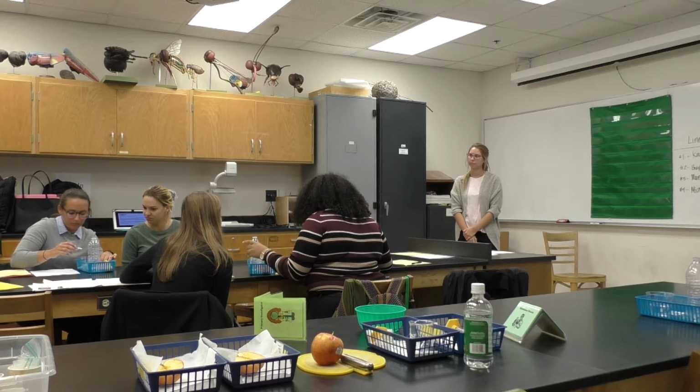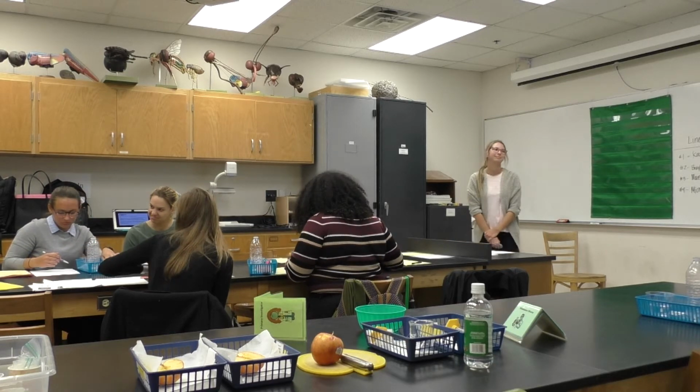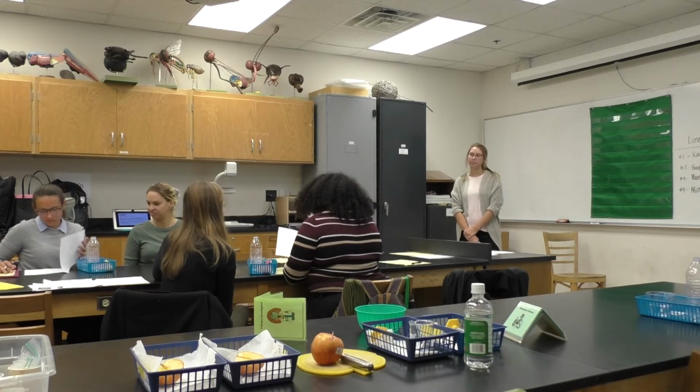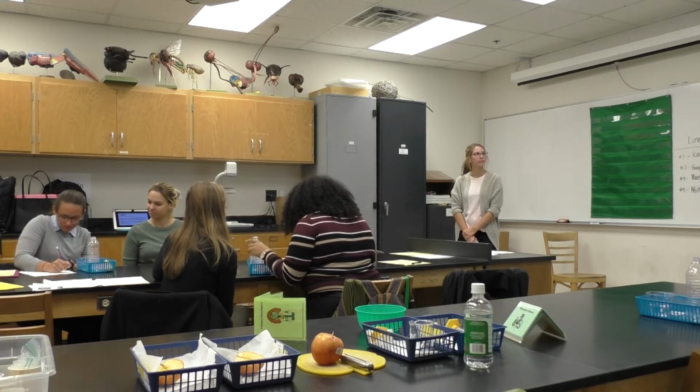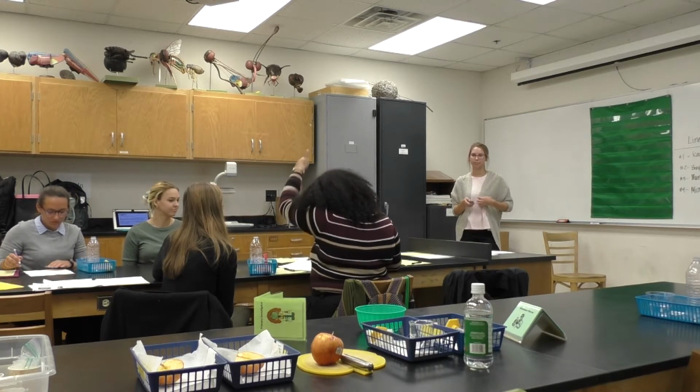I'm going to assume that the vinegar is in here. Wait, vinegar is in the water bottle. Got it. Should I check them on here? Yes, please check these things. Is everybody, do you have everything? Are you missing anything? Great, okay.